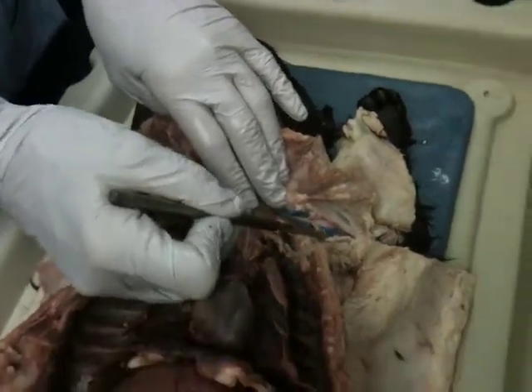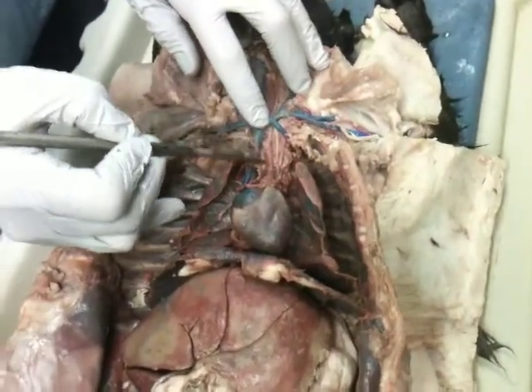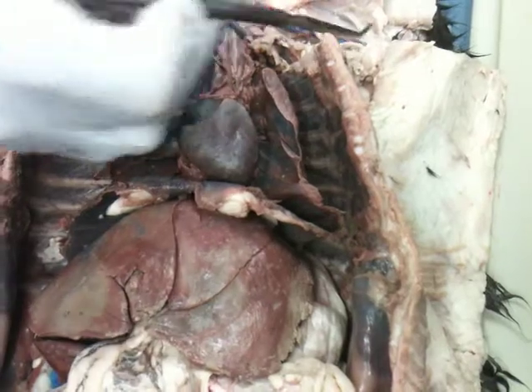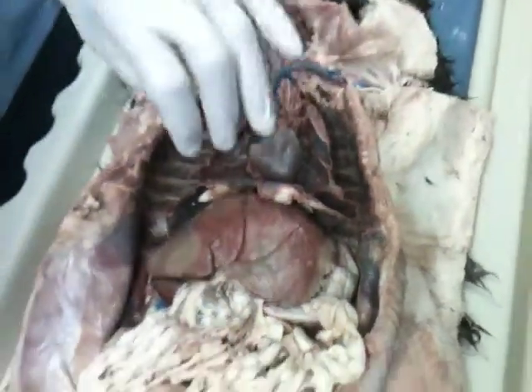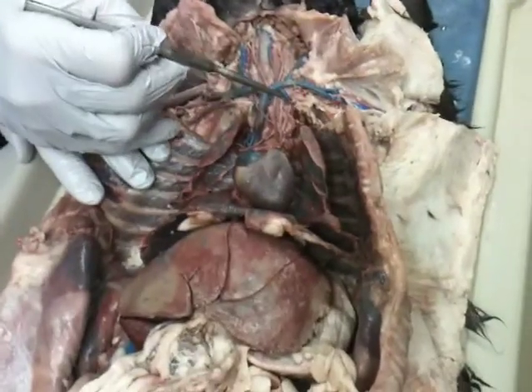So it goes the same order as the veins as well? Yes, same order. Subclavian, axillary, sends off things, and then the brachial. Okay. Any questions? First branch being the internal mammary. Yes, there you go. And generally, the second is the vertebral.